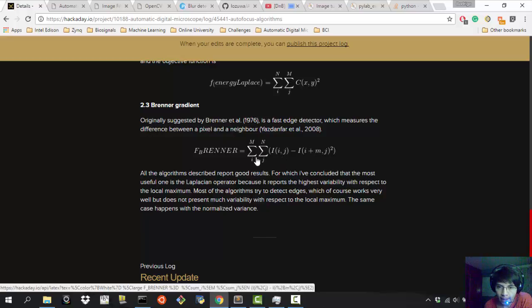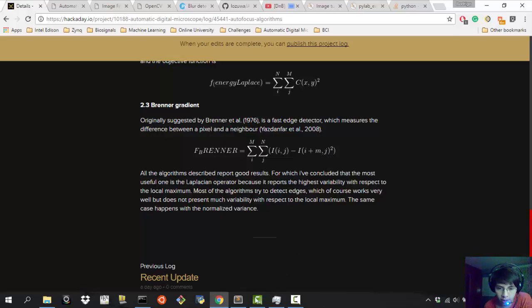And as you can see, you just calculate the power of the image, but without using the power 2. No, actually, you don't calculate the power of the image. You just take a pixel by pixel, and then you subtract it from a pixel that is m spaces away from this pixel. Okay, and that's going to find an edge, as you know, because edges have a different value, and that means that we have an edge. Okay, so that's why we're subtracting this, and we have this power to the 2. So there's something wrong here. This 2 shouldn't be here. It actually should be here, so be careful with that, and I'm going to show you this.